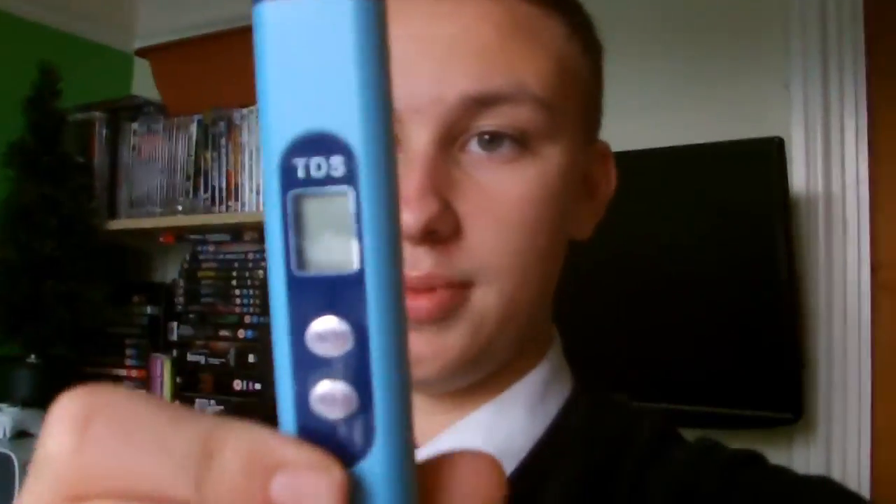It was in the region of about five quid. The interesting thing about this is I'm going to be able to take a water reading, record it, and then if I do it every month or so, if I see a spike on the parts per million meter, it's going to tell me that something is being added to my water.